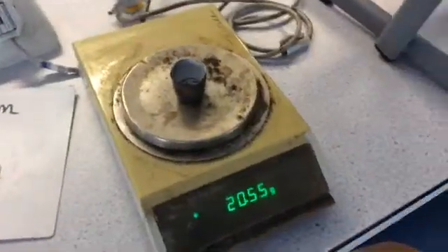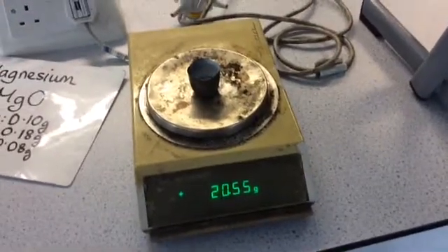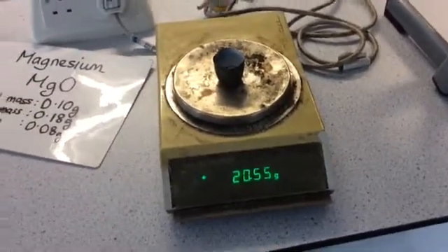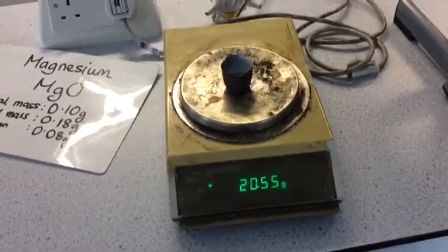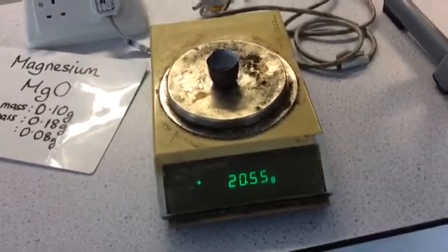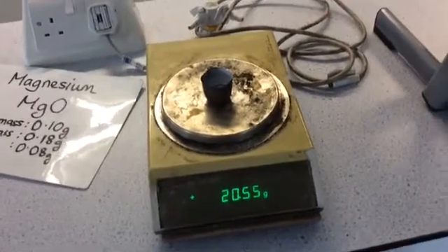You can see that my mass has not changed at all. And that means that when I reheated it, the magnesium must have already fully reacted. If it had increased, that would show me that more oxygen had been added and therefore the reaction hadn't been complete.